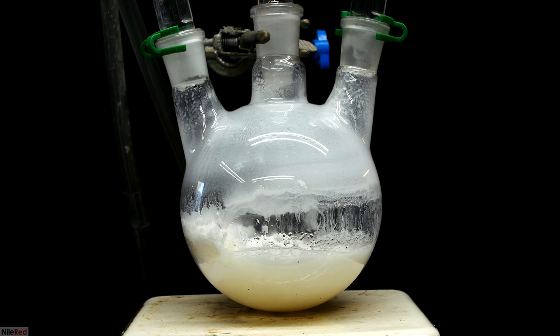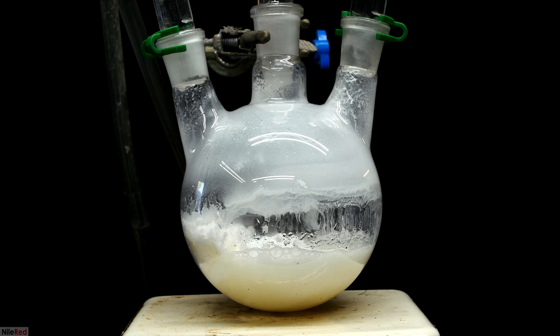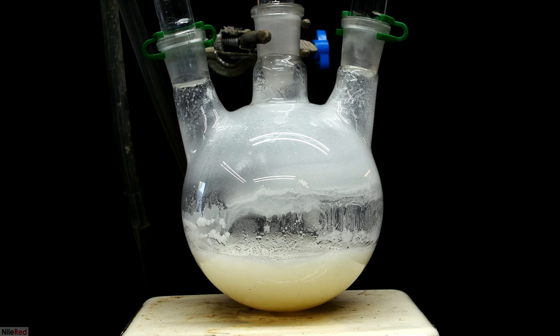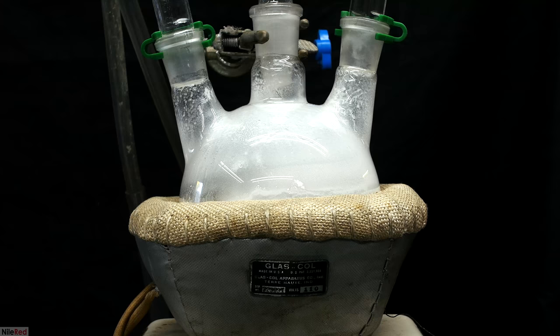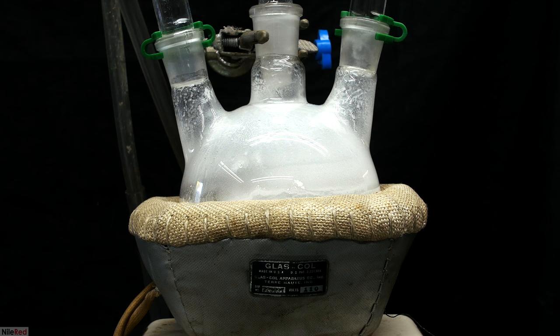Because the reactants weren't mixed very well in my case I actually did have to do a kickstart. I let it stir without the heating mantle for a while and it seemed like more stuff liquefied but the reaction never really got going. I put back the heating mantle for about 30 seconds and this was enough to get the reaction properly started.